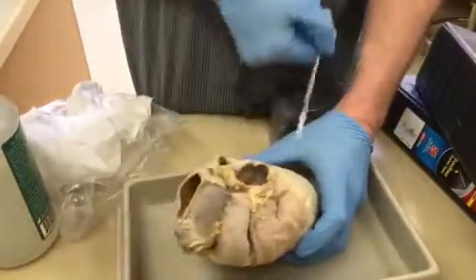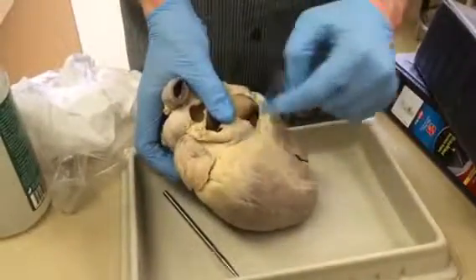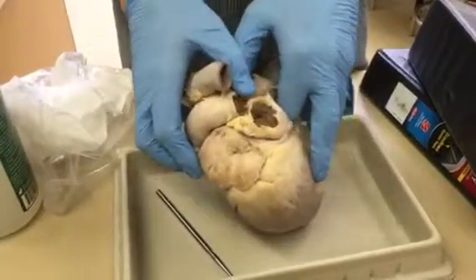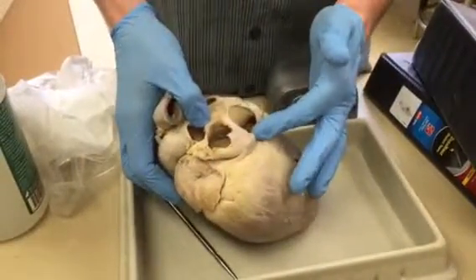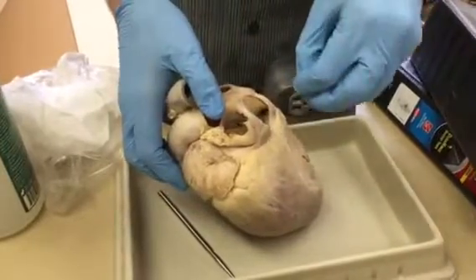Okay, now you pull that out. And then we just said the coronary sinus also drains. So both of those are bringing deoxygenated blood into the right atria, and the coronary sinus we just talked about is bringing blood in. So those are the three vessels that are dumping blood in there.